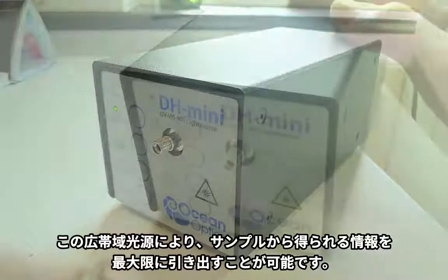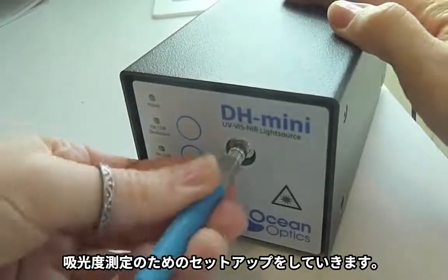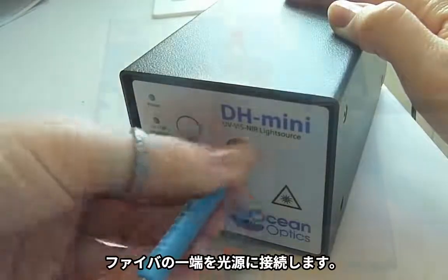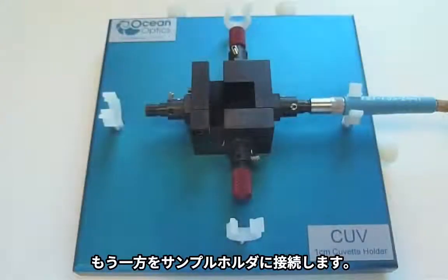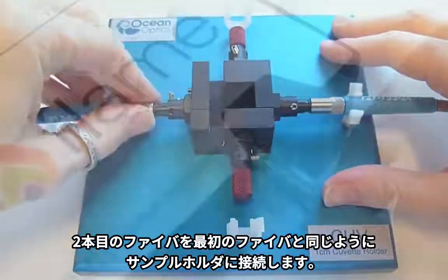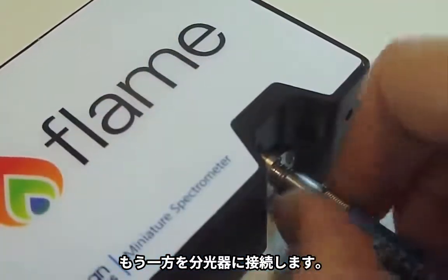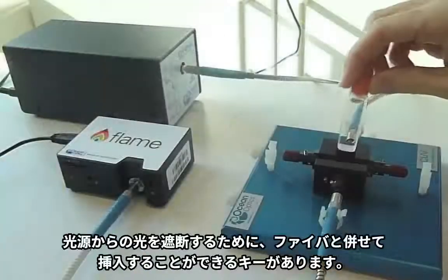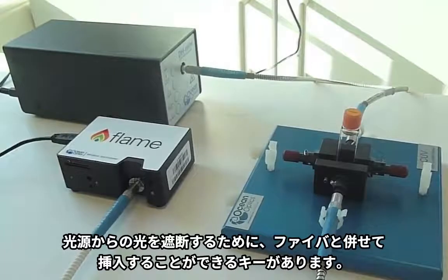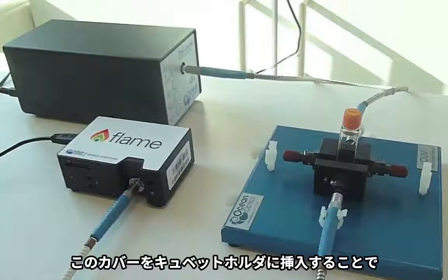To set up the instrumentation for absorbance measurements, we will simply connect one end of a patch cord to our light source and the other end to the sample holder. We will then attach the other patch cord to the sample holder in line with the first and the other end to our spectrometer. You will see that a cuvette can then be inserted in line with the optical fibers to intercept the light coming from the source. This is where the absorbance happens.